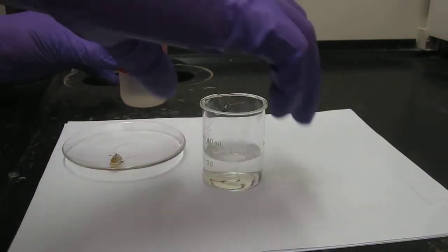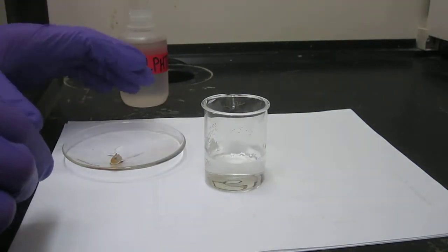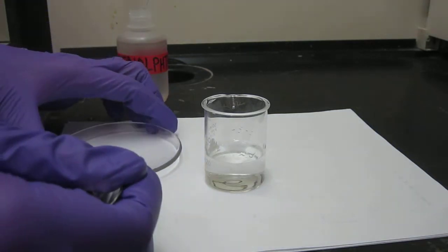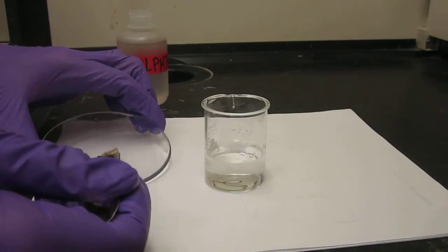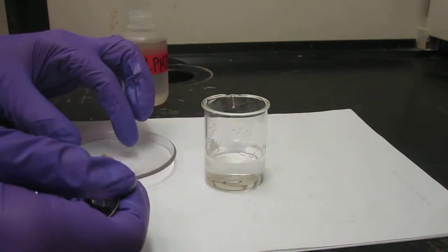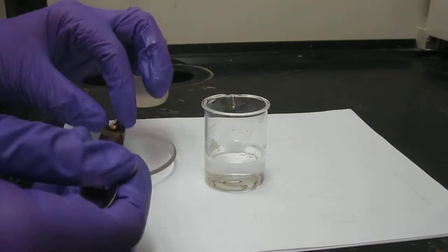Okay, we'll mix it up. And then we have a piece of sodium here, and I've got the spatula that I've used. The sodium you can see is in this mineral oil, it's the sodium metal here.